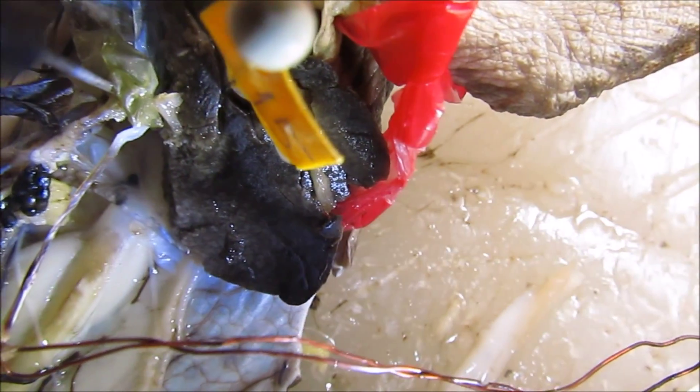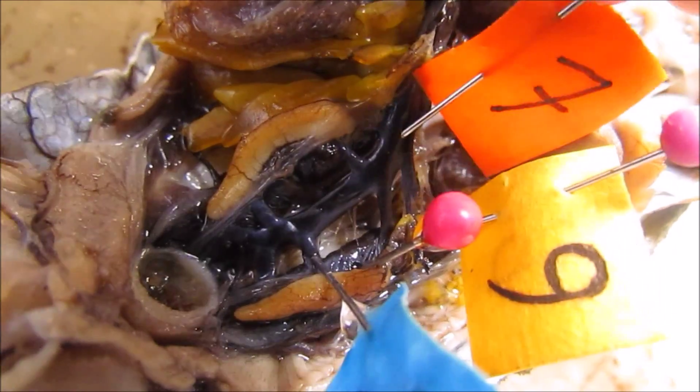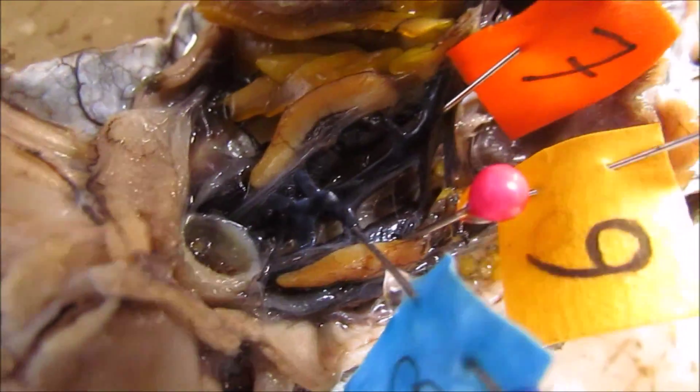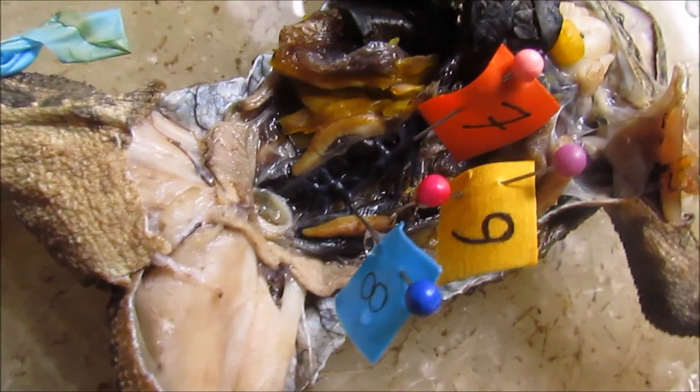How to determine hepatic portal and hepatic vein? So this is the postcaval vein, this one. And then the renal vein, this one.